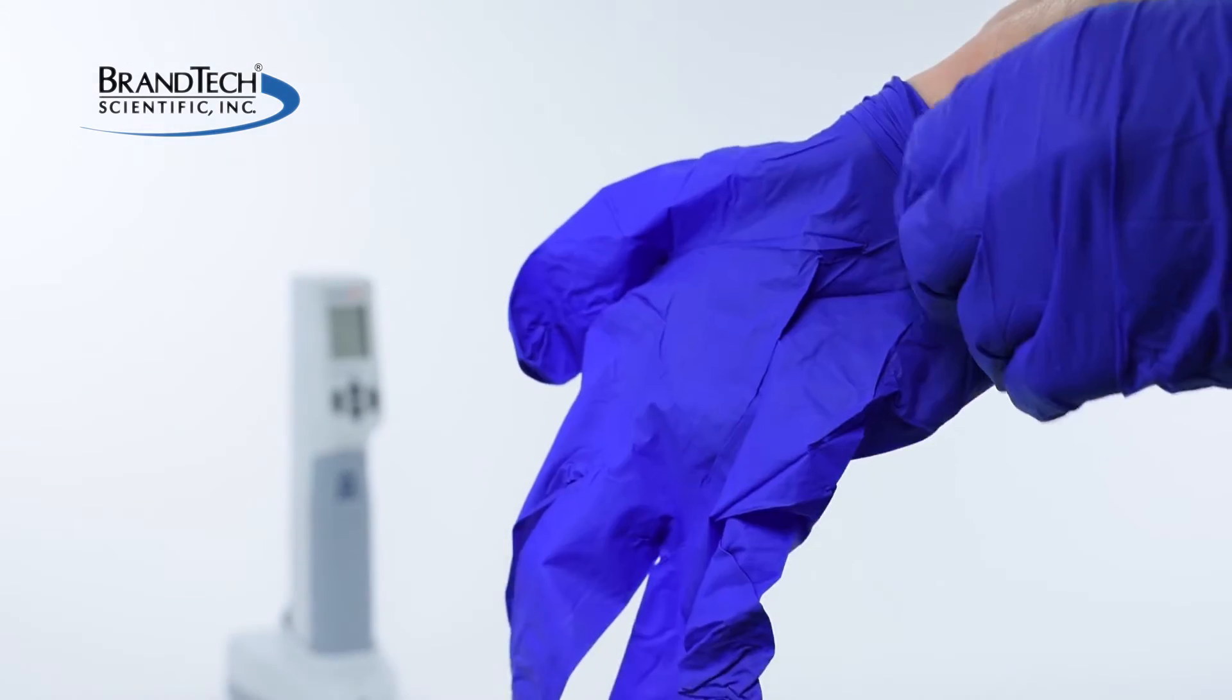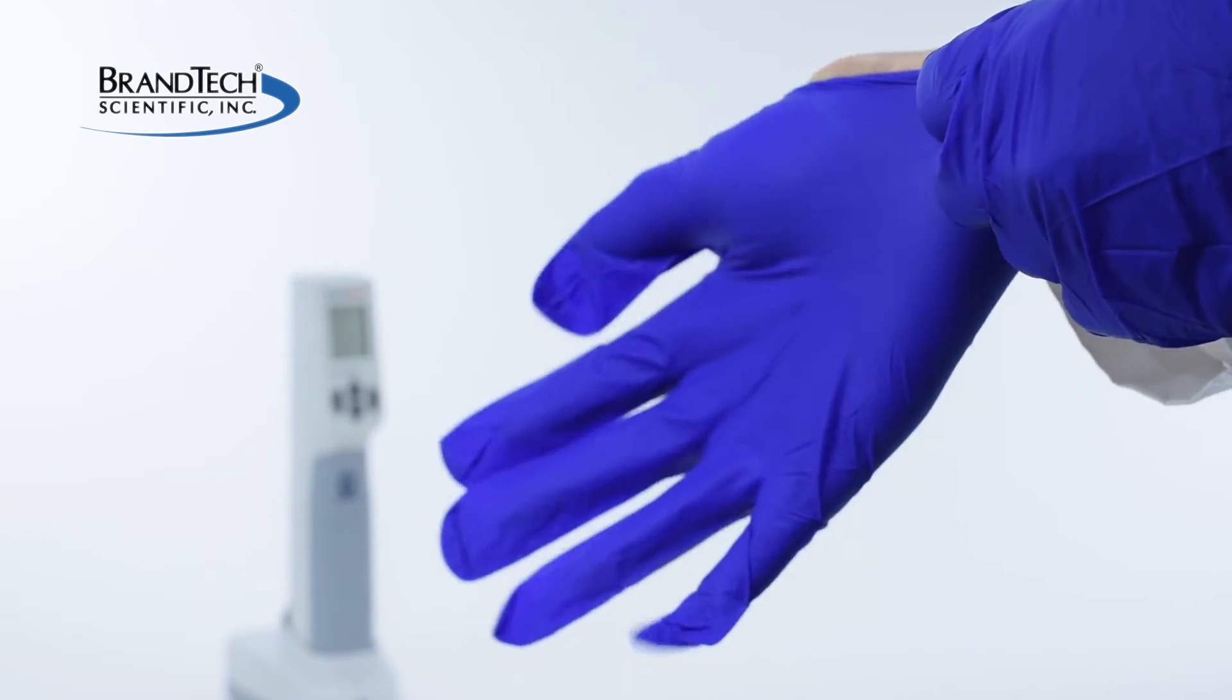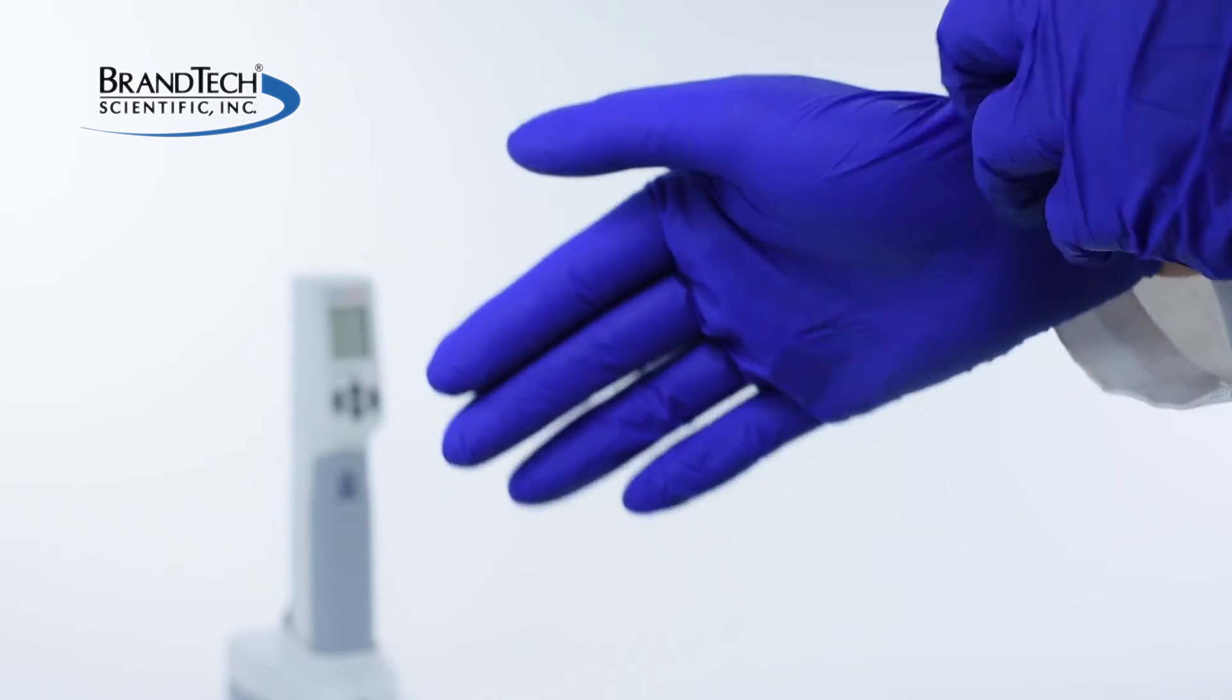Before working with the HandyStep electronic, wear all the appropriate personal protective equipment and observe all safety precautions.